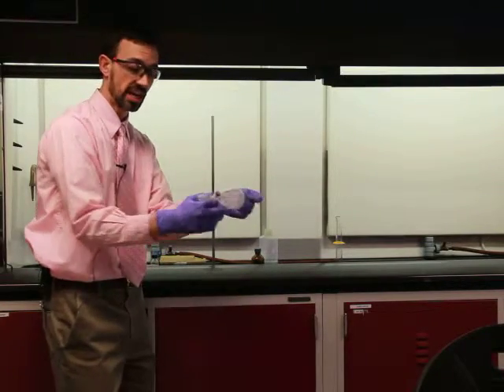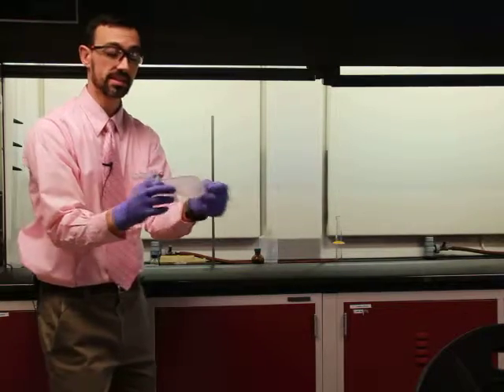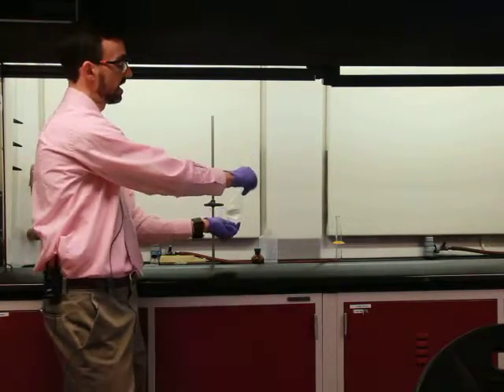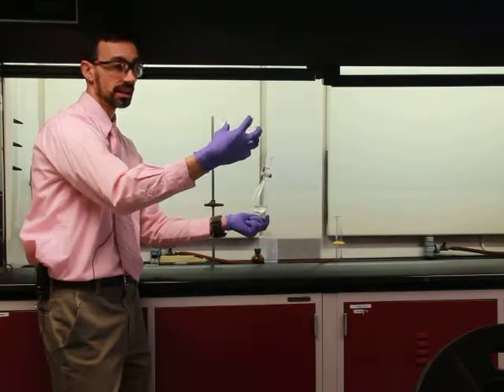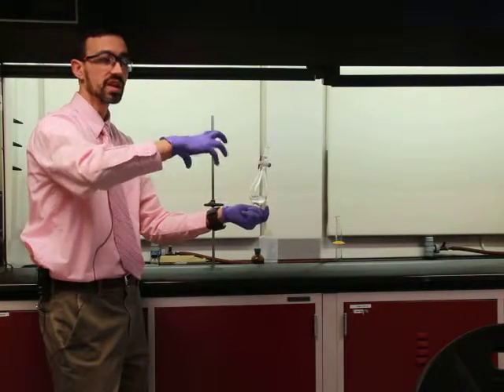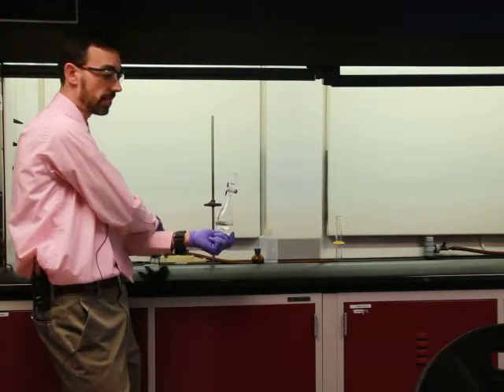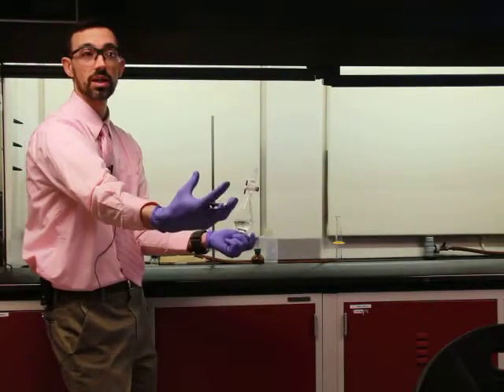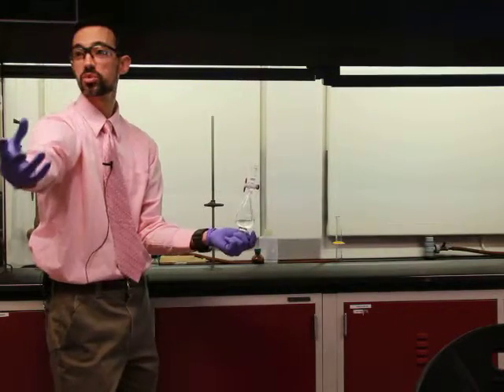But this is the technique now. We just need to shake this to try to mix those two solvents together, just like salad dressing, okay? And then we vent them. And it's when they're mixing that literally molecules of ether, which are attached to our chemicals, all right, are being introduced to water molecules, and then we make like a custody exchange, so to speak, all right?